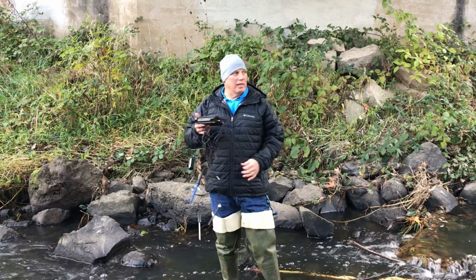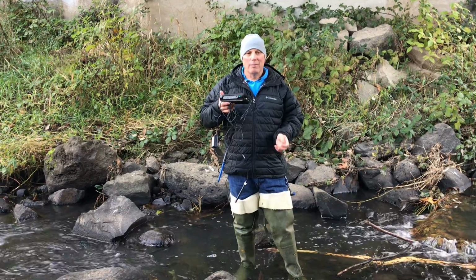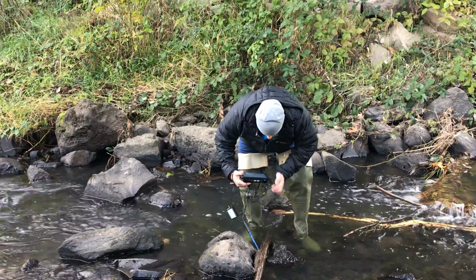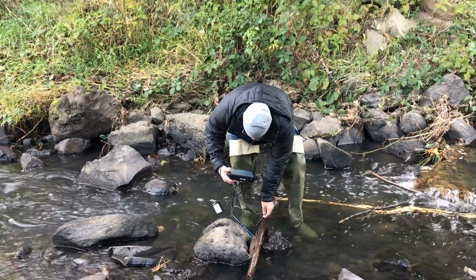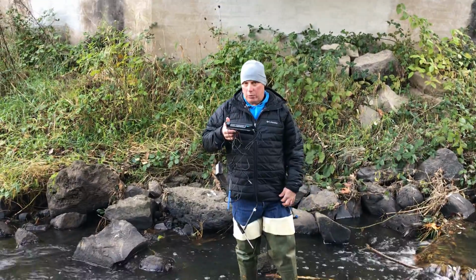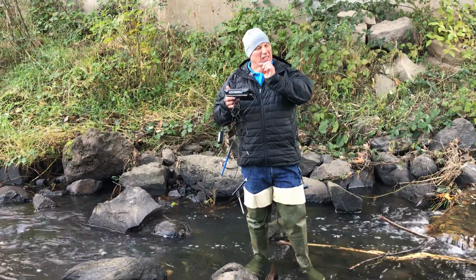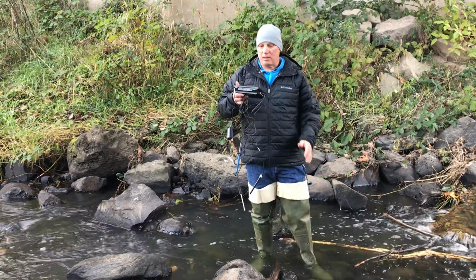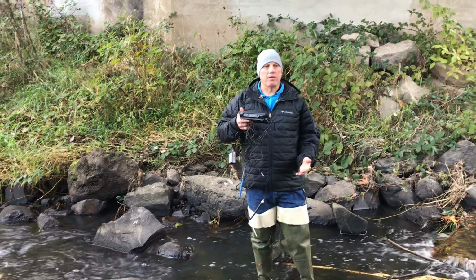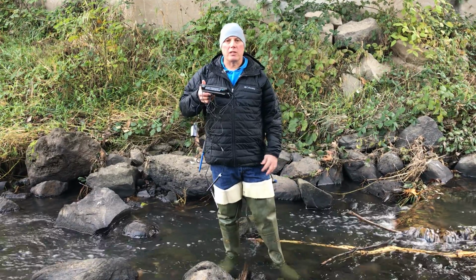Now, this is a pretty clean stream, though it does come through the farmlands, which do add pollutants to it, but I would expect it to be fairly clean. Let me check it. Oh, better turn it back on. Woo, 153. So again, just a tiny bit higher than what I expected, but pretty good. And so the quality for fish that live in Beaver Creek is pretty good. All right, we're gonna run off to Johnson Creek and check it next.